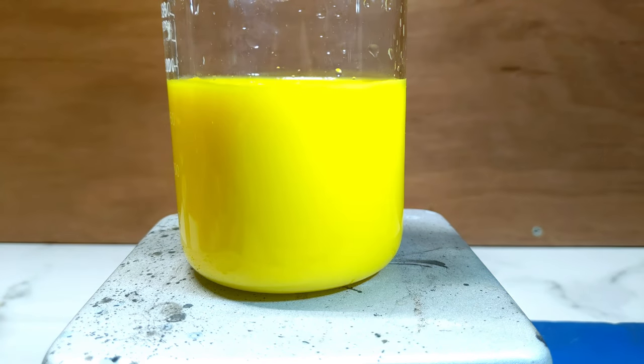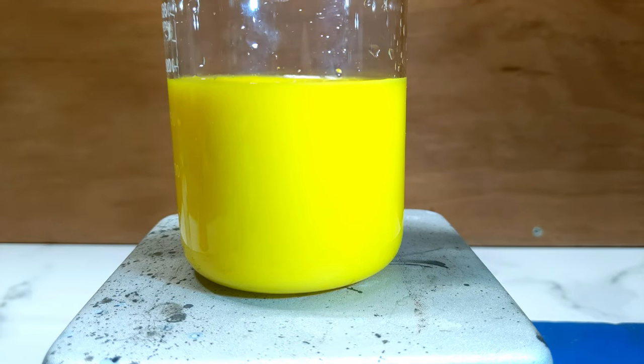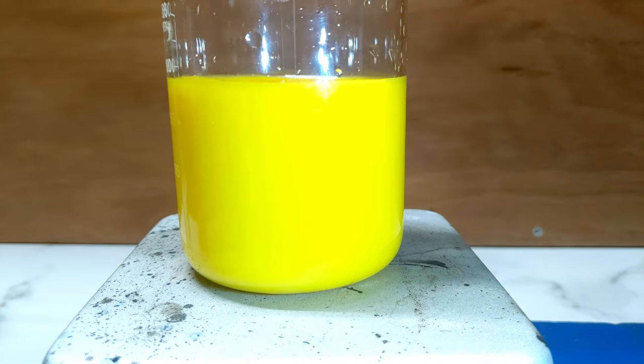I'll need to just top up. I'm just going to top up my dichromate at the top here so we can keep the dripping process going.